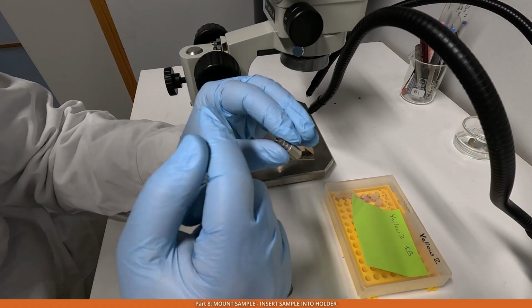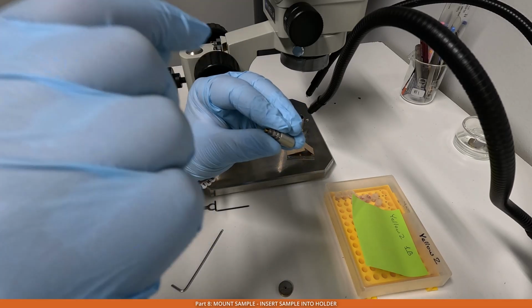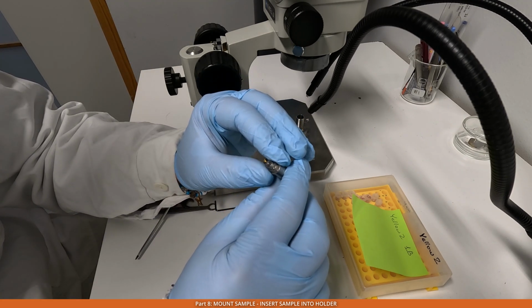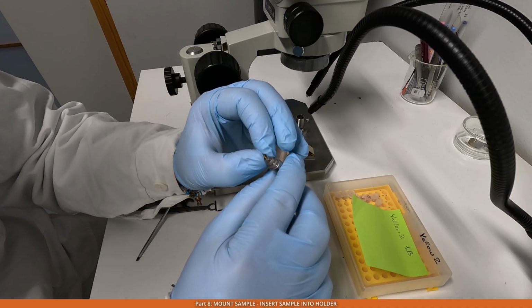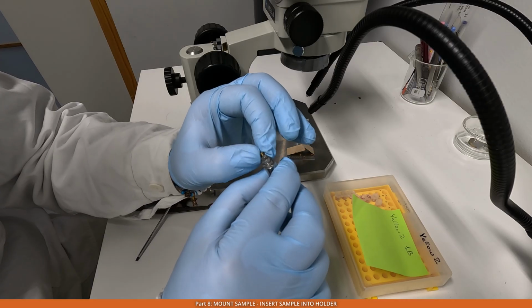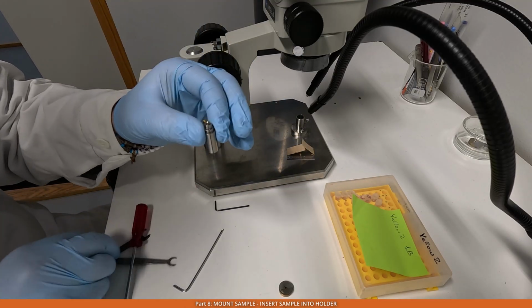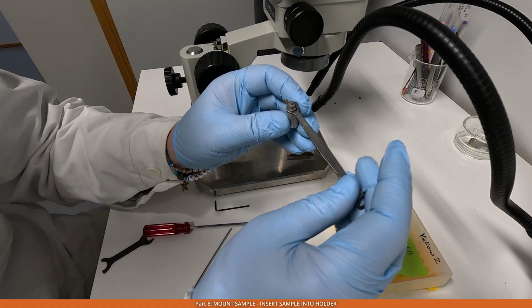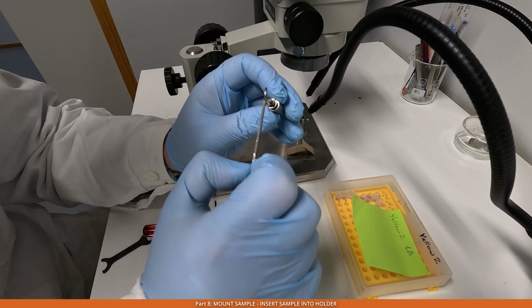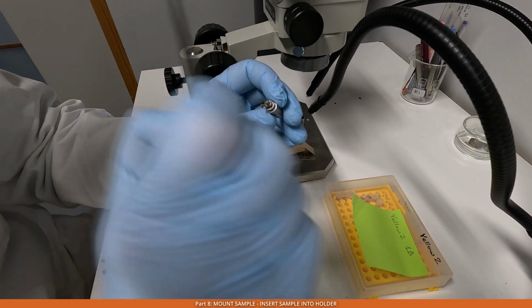The next step, I will go under the stereo microscope. I will rotate my sample so that its shape is kind of favorable. Maybe I'll be able to show it later, I don't know. And then I will tighten the screw. So now the screw will hold the pin inside of this assembly. And then I will use these wrenches to rotate the cylinders to make sure that I will bring the center of my block face of my block will align with the cross that I have in the microscope.